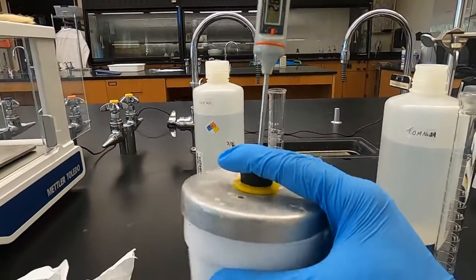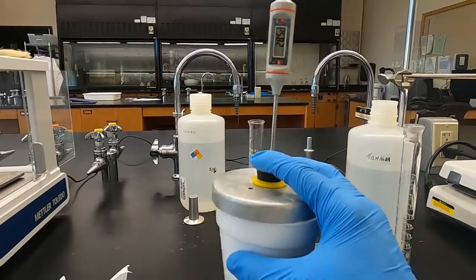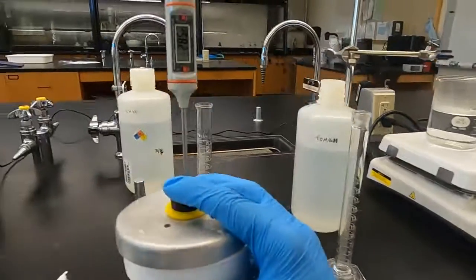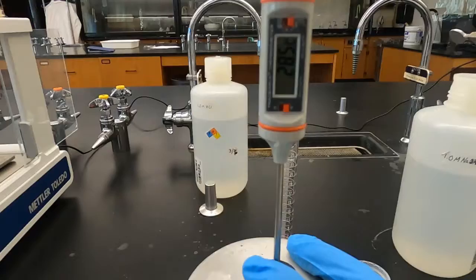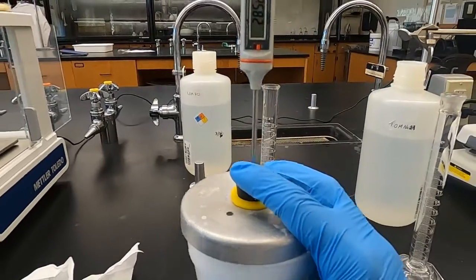Again, I'm not gonna show the whole cleanup. We don't need to see all of that, but there are a lot of additional steps with this lab that happen even after the results. Waiting for this hot plate to cool down. But we're looking like we're done now. 28.5 is what it decreased to, so 28.7 degrees Celsius is our final temperature with that reaction for part 3.